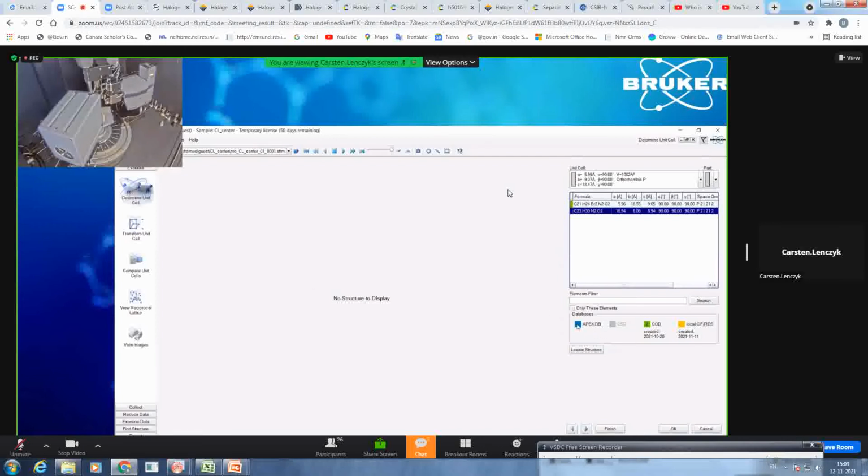The other two databases: this is the database where everything that has been processed on this PC locally will be stored. You can also define your own database, also locally on this PC. For example, you have one folder where only publishable structures are. So if you find it here and not there, you know, okay, I have to remeasure a good quality crystal for publication. Or you can also use a directory on a server, for example, so you can cross-check if anybody in your whole institute has already measured it.